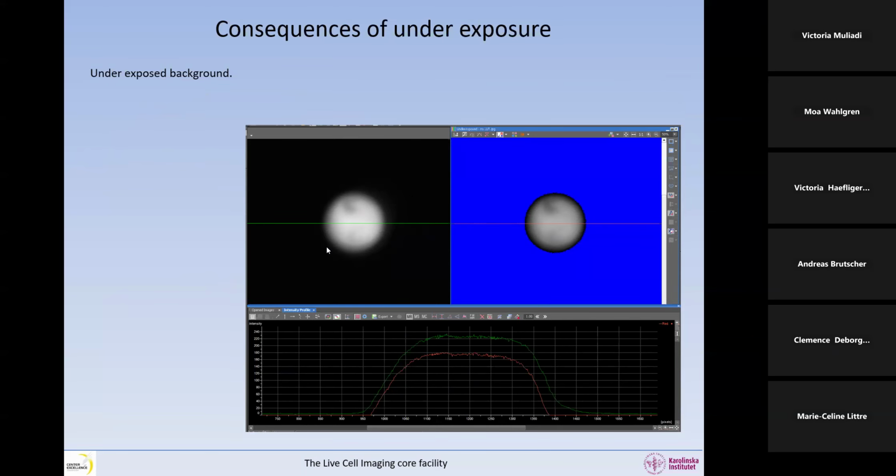And what you can see, so this one, if you remove the lookup tables, is going to go very low contrasted. So our eyes love contrast. So we're going to be, oh, I love that one. I'm going to use that. No. Because you can see here that we have a smooth edge of the bead, because of the loss of contrast in the microscope. And here we have a much sharper edge, and also the diameter of the bead is smaller, so this one corresponds to this image.